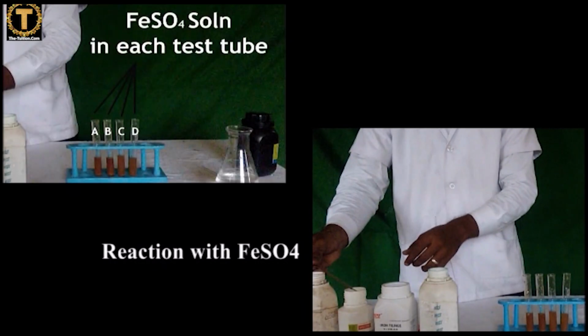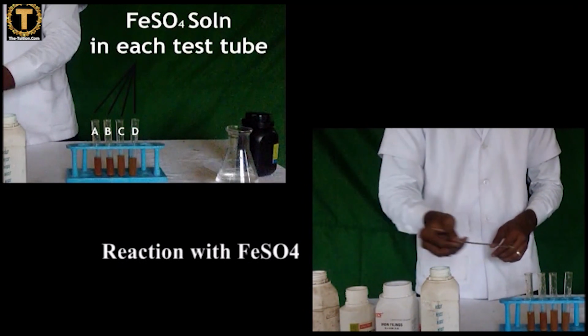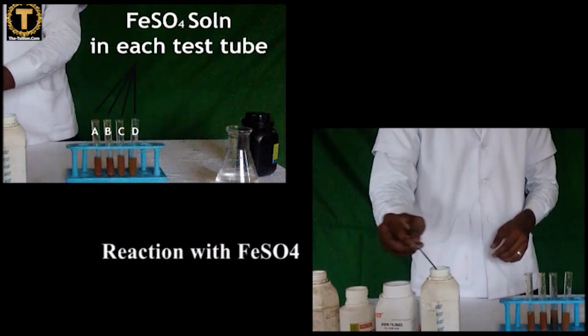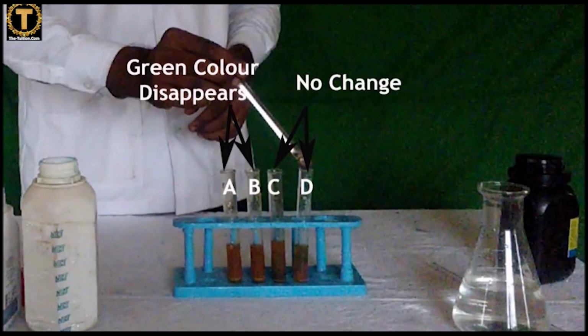Reaction with FeSO4 solution. Now take FeSO4 solution in each test tube. Again, dip a small clean piece of aluminium, zinc, iron, and copper metal in each test tube respectively. And now the observations are recorded.